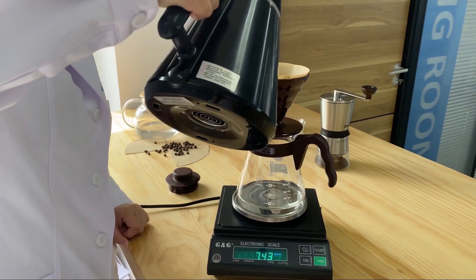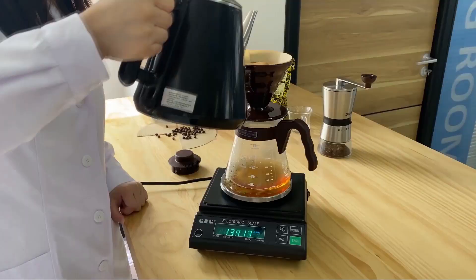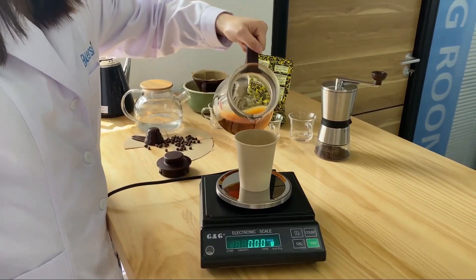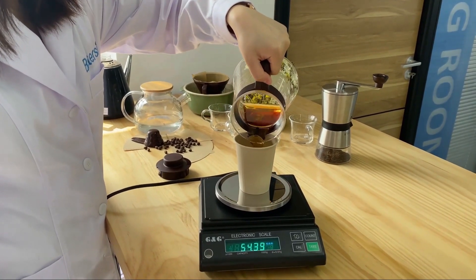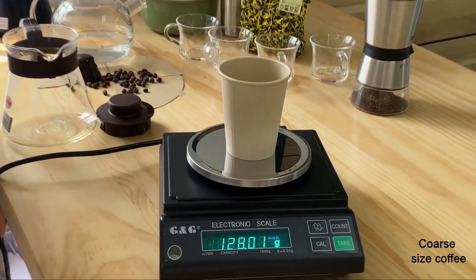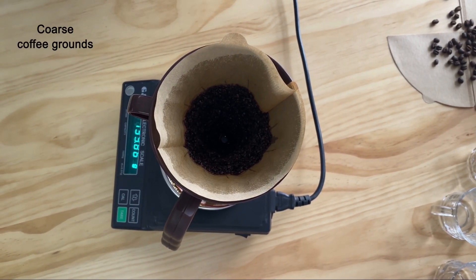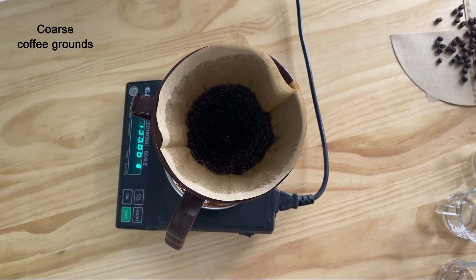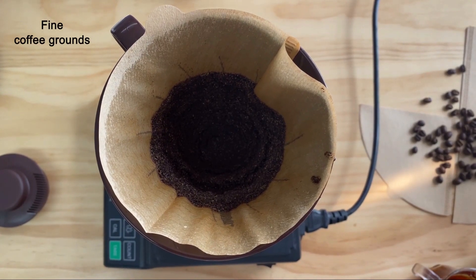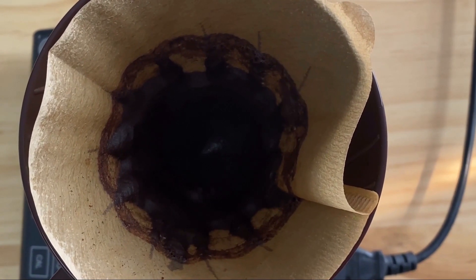A balance is set up to control the amount of water used to brew the coffee at around 140 ml. Repeat the brewing steps for all four grinds. Next, we will weigh the brewed coffee to compare the extraction level of each grind. We can see that the coarse grinds produce the most brewed coffee while the extra fine grinds produce the least. After brewing, the leftover coffee grounds look different — the coarse and medium particles are still distinguishably separated, while the fine and extra fine particles aggregate and tend to move to the bottom part of the filter.